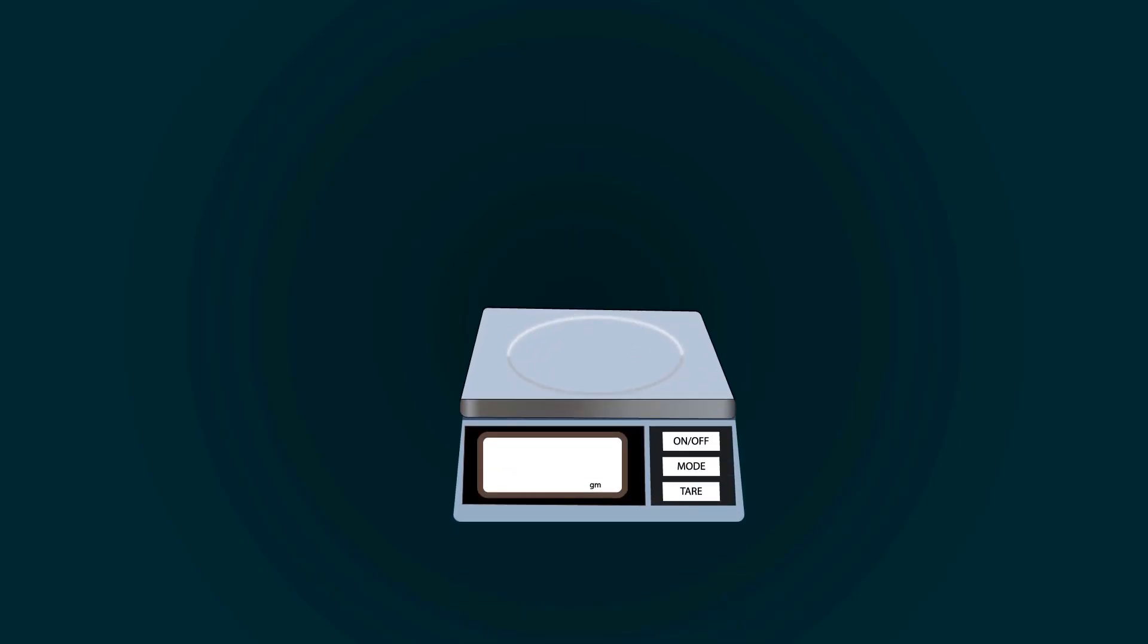First of all, take a weight balance and power it on. Now, put petri dish on it. Don't forget to tare it.